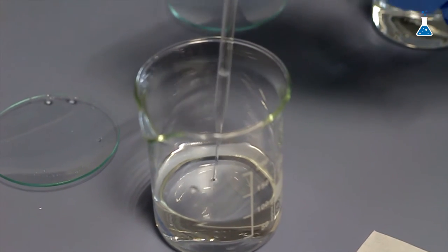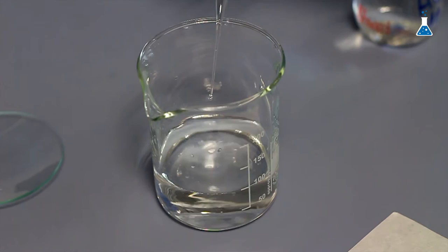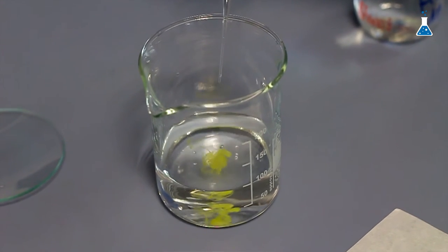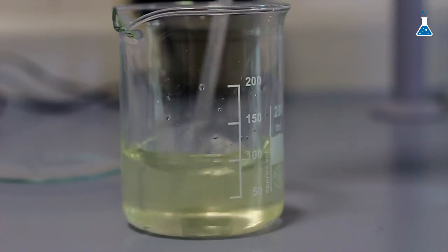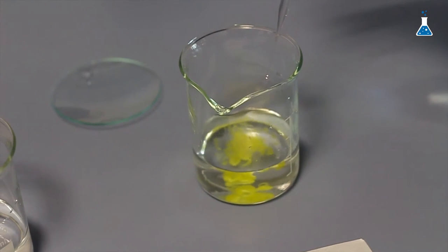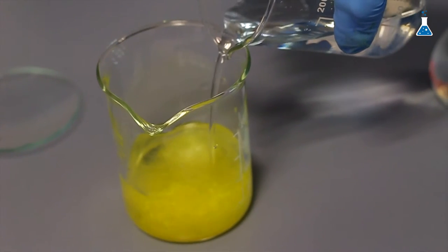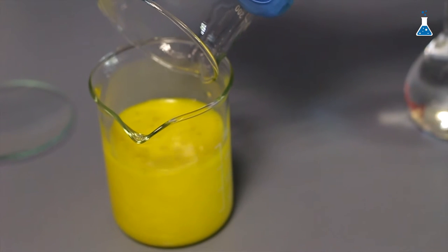Let's first add the solution of lead nitrate dropwise to the solution of potassium iodide. You can observe how a beautiful yellow precipitate is formed when each drop comes in contact with the solution. However, the solid redissolves when we stir the mixture because it is slightly soluble. Let's continue by adding a couple more drops. You can see the bright yellow color.